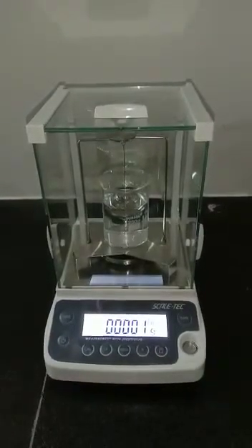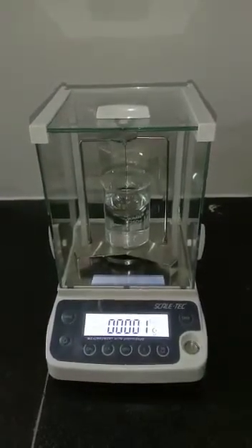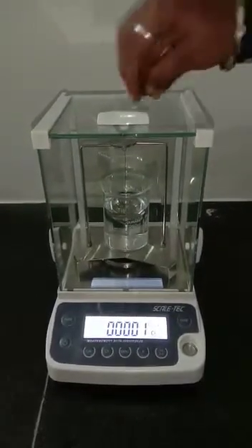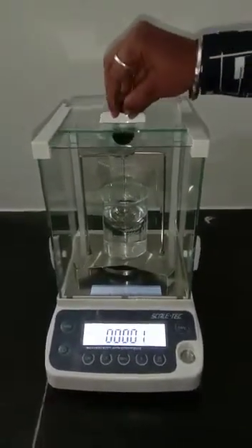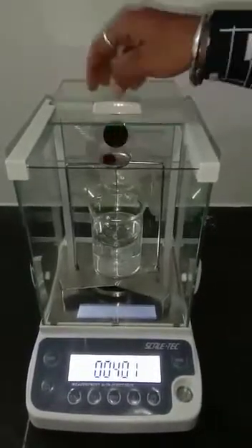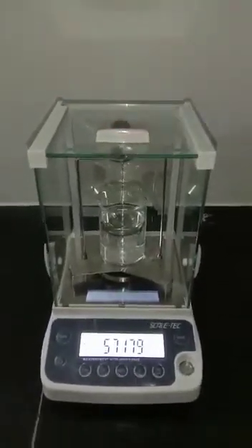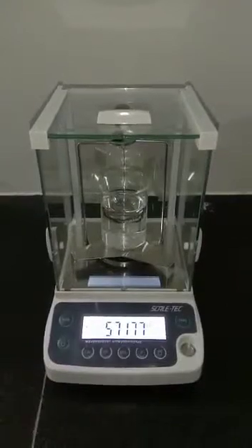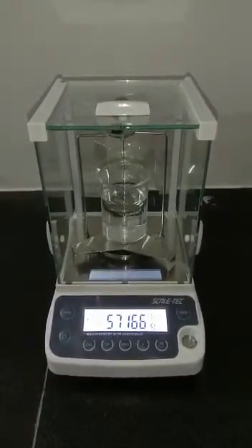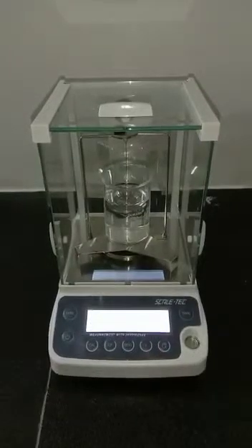You just need to put the material of which you want to find the density on the upper side of the weighing assembly. Whenever the digits are stable, you are done — press F.